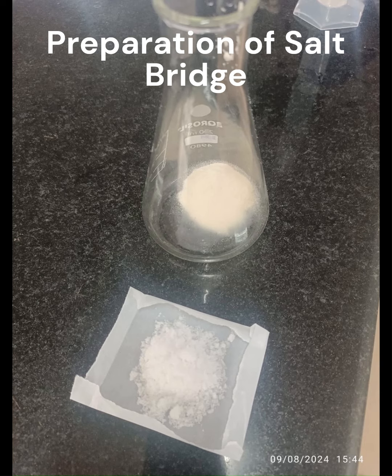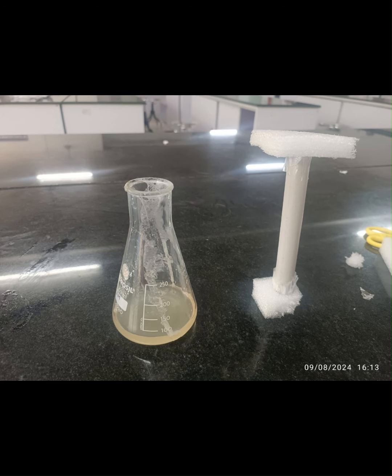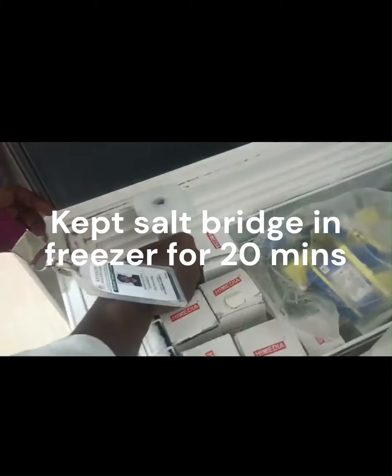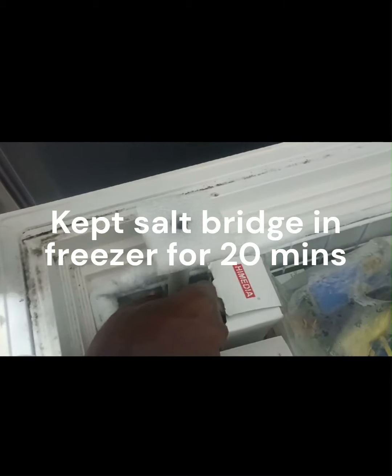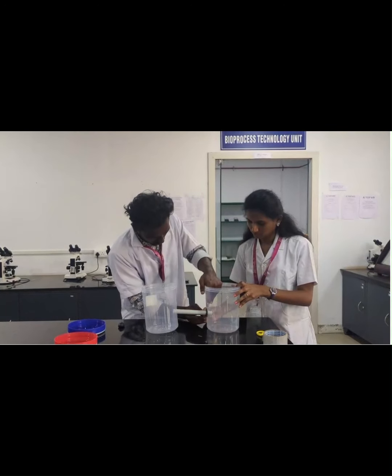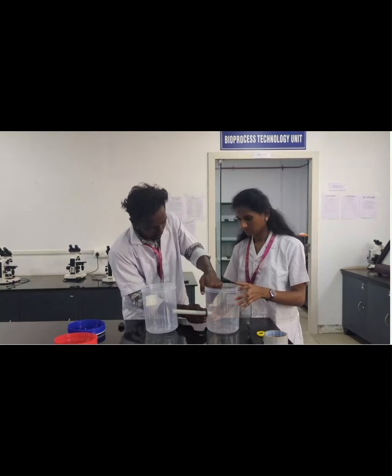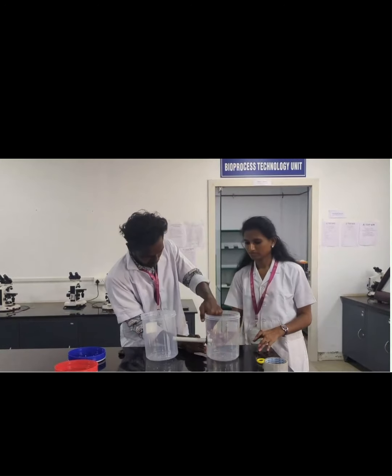We have poured agar and salt, that is KCl, and kept the salt bridge in the freezer for 20 minutes. This is how we have connected the salt bridge. We took two containers, one container containing distilled water.